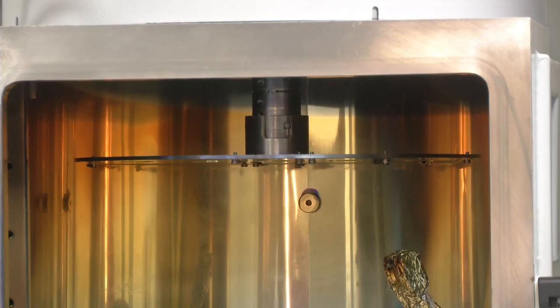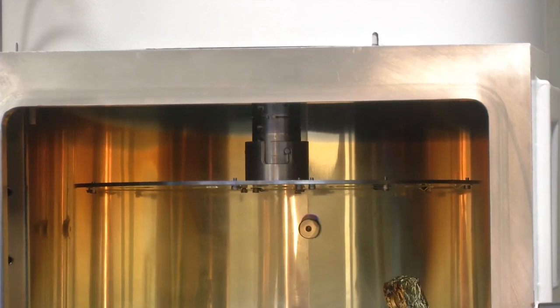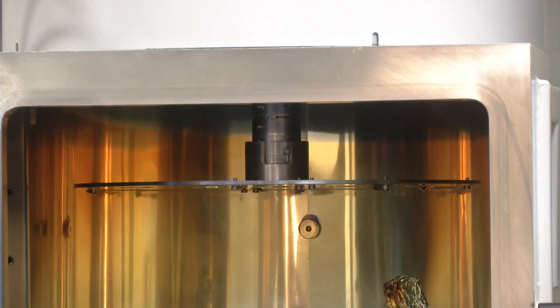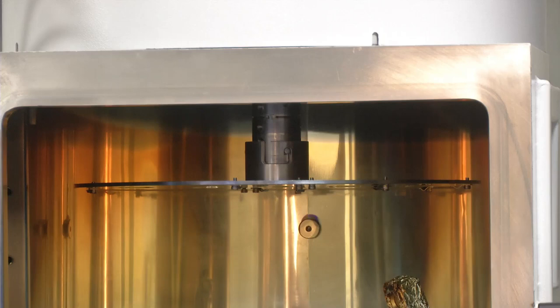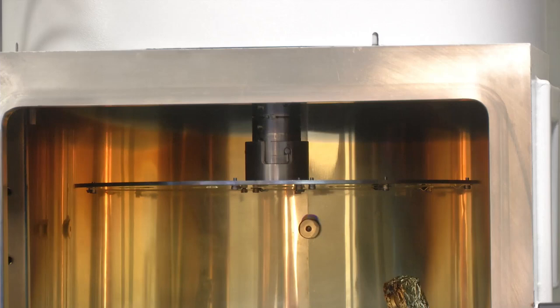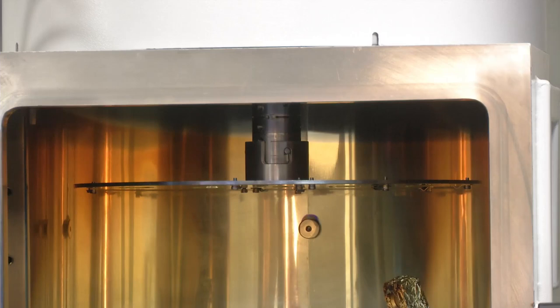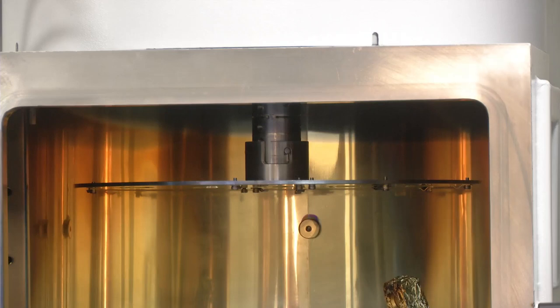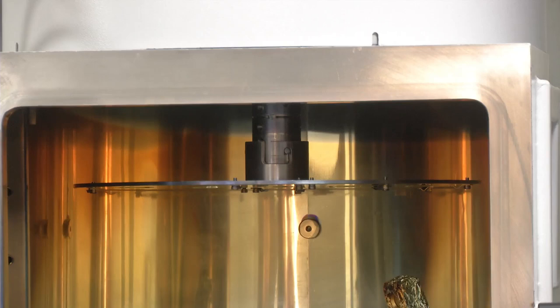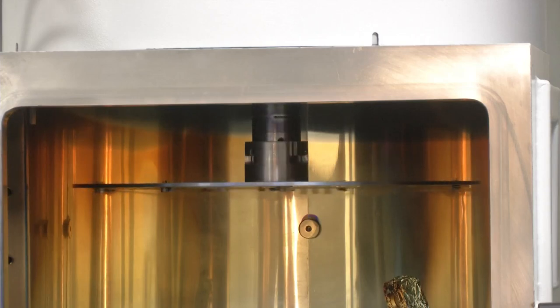Another important feature of an electron beam evaporation system is the rotating chuck. The rotating chuck allows uniform deposition when multiple substrates are loaded. If we do not rotate the substrate, the evaporated metal will not fall uniformly on all the wafers. By controlling the rotation of the chuck, we can obtain a very uniform layer for all the substrates. As my colleague shows, after pressing the knob the chuck starts rotating, and this process can be done without breaking the vacuum.